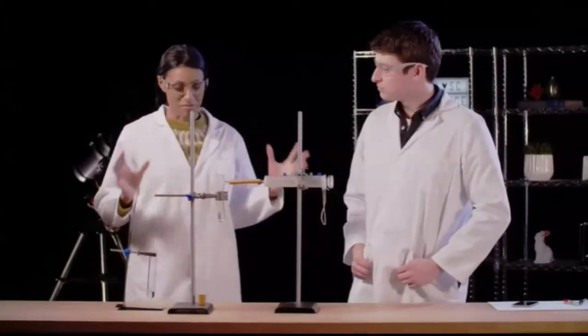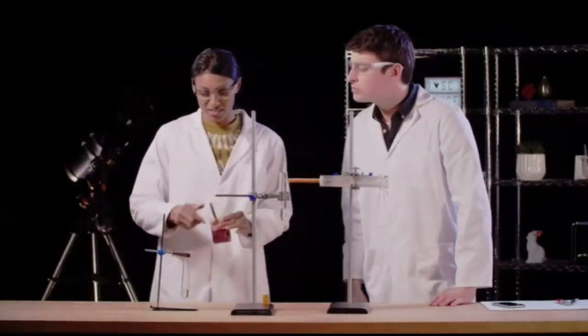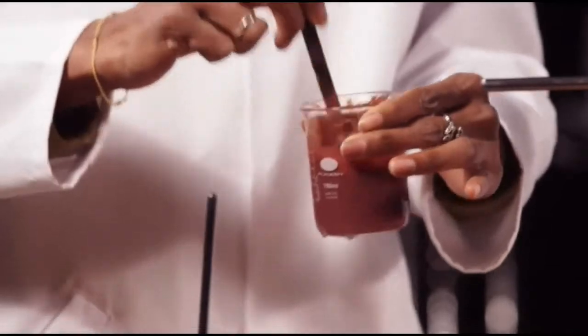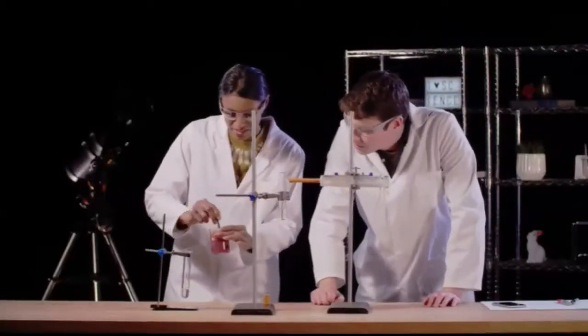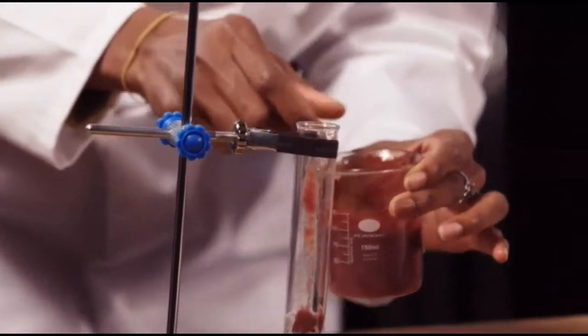We've cleared up all of that mess and we're left with 2 test tubes full of hydrogen peroxide. Now, I'm going to add some of this sludge to one of the test tubes. This has been made in a food processor and it's fresh beef liver mixed with water. Now, in the test tube, I've also added a squirt of washing up liquid, and that's to help us see the reaction as the gas gets generated. So a lump of it goes in there.